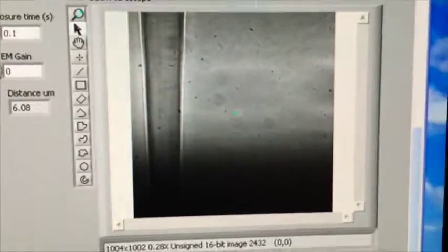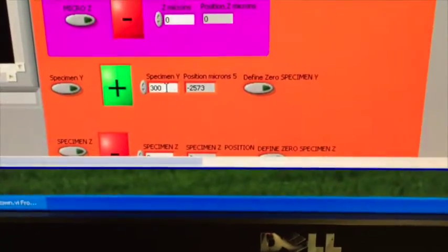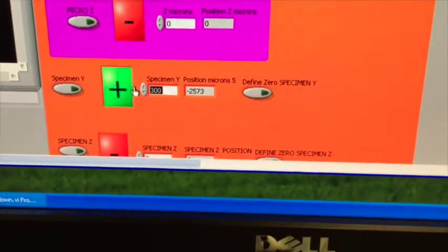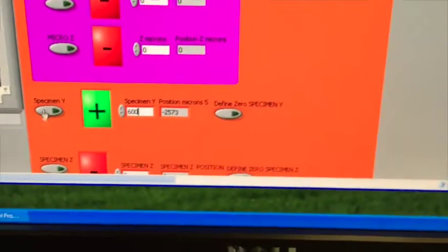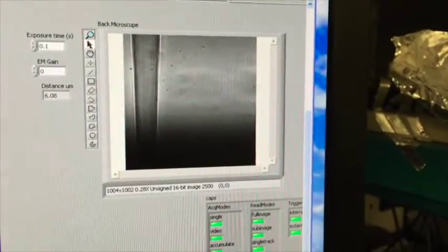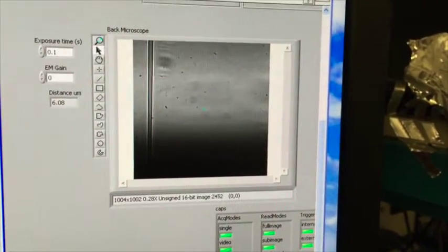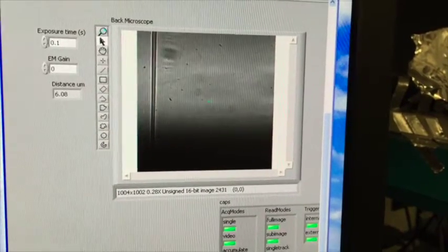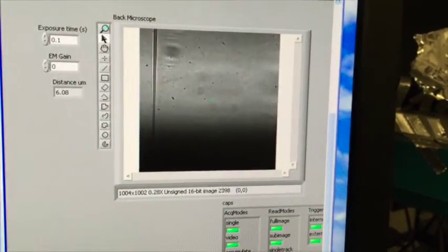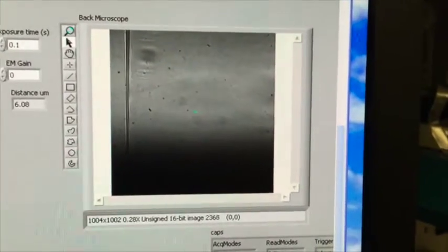So I'm going to pull this up to get to the narrower part of the tip. And the way I do that is right here on my Y sample. Plus means up. When I'm moving in big steps, I like going in steps of 600. Let me dial that in. This is a button to make it go. Plus means up. So as I hit that, we're going to see this get a little bit smaller. And for the purposes of this first part, I want to kind of roughly have it about the size of that little green slice right there. And that's about where I want it.